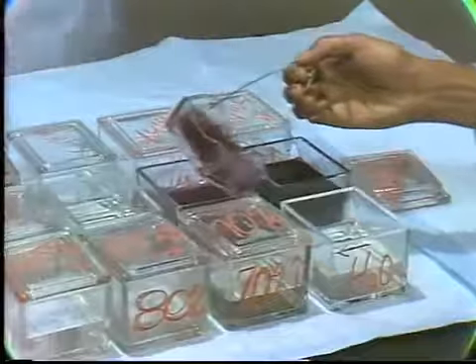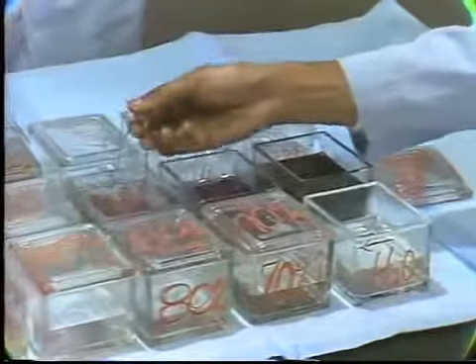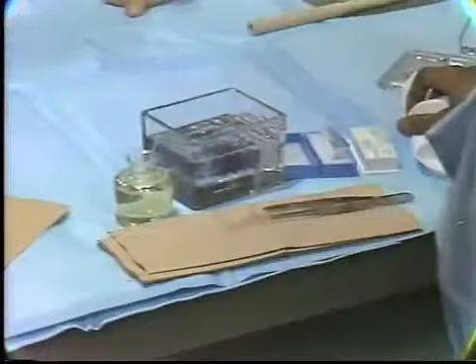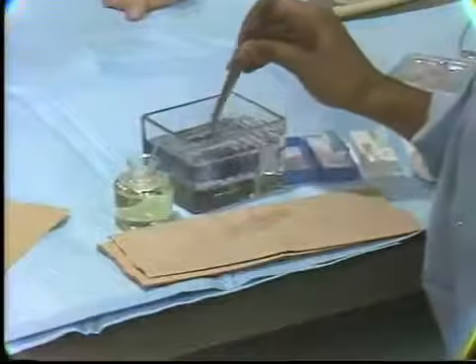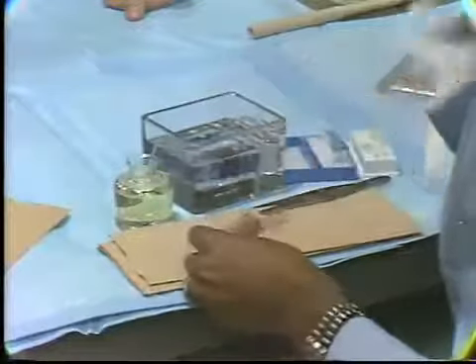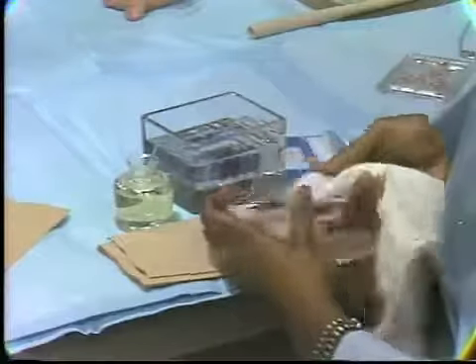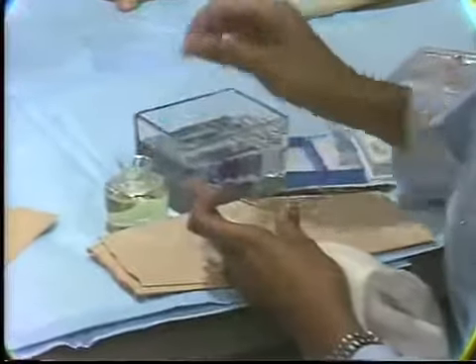Once the staining is complete, the slides will be covered with a cover slip, and this procedure is called mounting. Mounting is the last step prior to observation. This is necessary to prepare a permanent specimen for viewing. This procedure of mounting now involves placing a plastic mounting media over the stained sections. Doing that now.